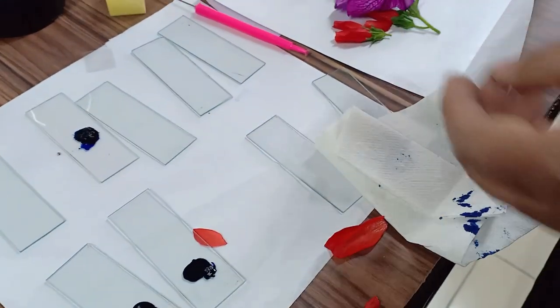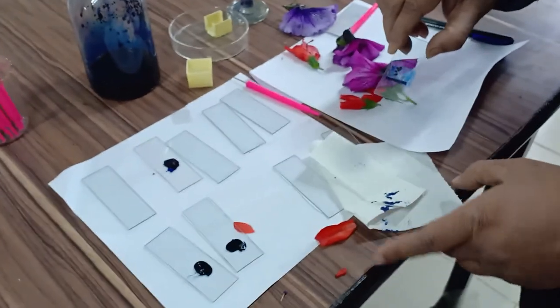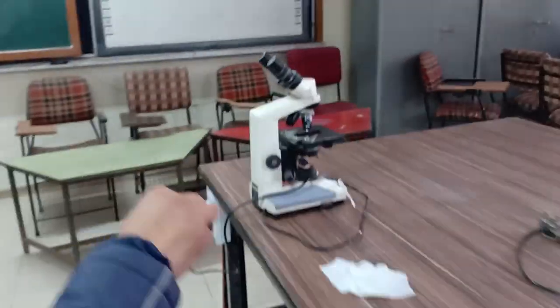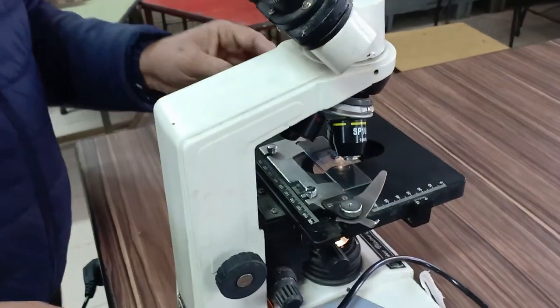Whatever extra dye is present will be absorbed by the blotting paper. After completely drying the slide, place it on the platform of the binocular microscope for observation.